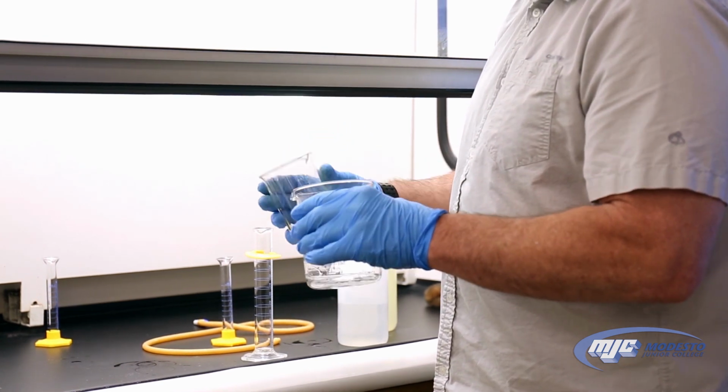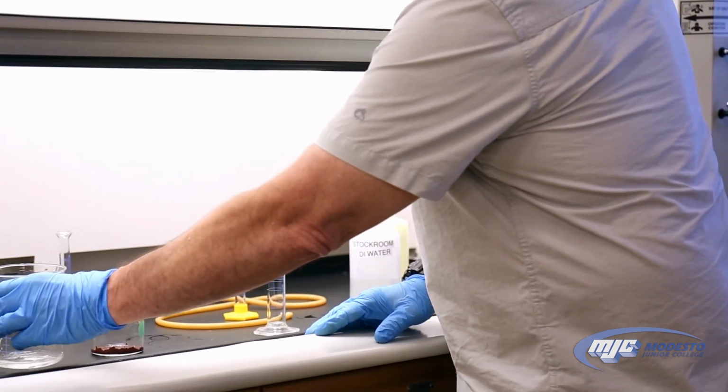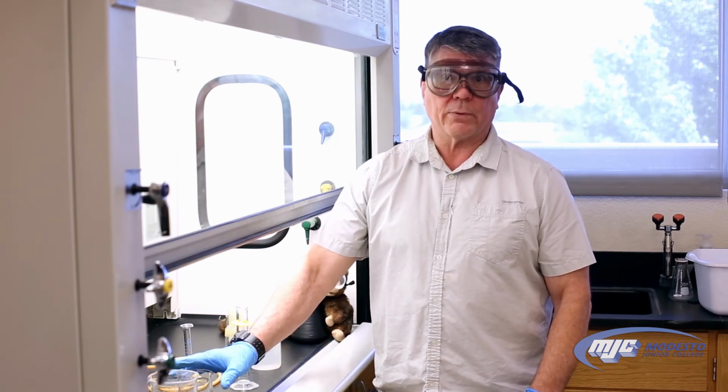Now if we don't quite get it all out, that's okay. This will absolutely evaporate over the week. And that's all there is to it. We'll come back next week, weigh the dry copper, and we're finished.